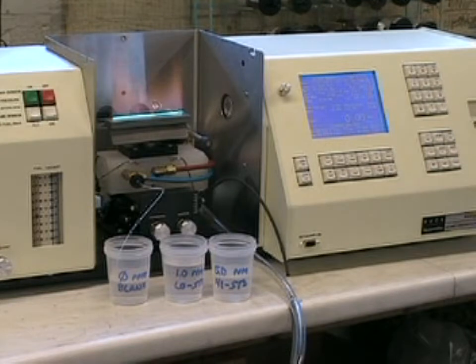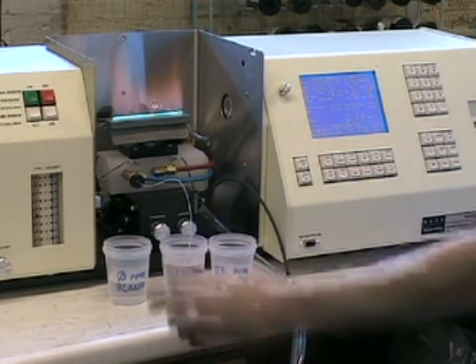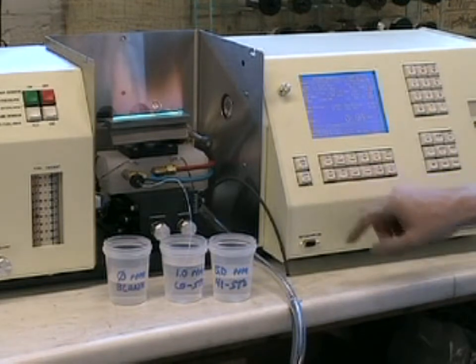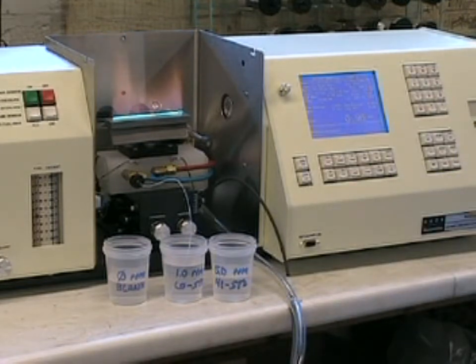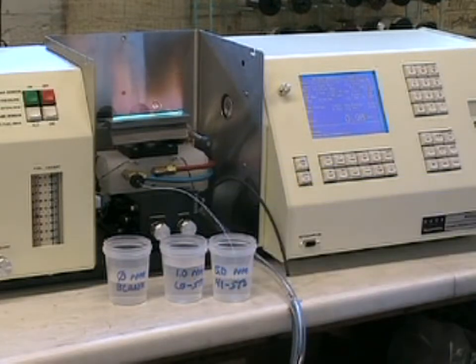Based on a satisfactory calibration, samples can be read by aspirating the sample, waiting a few seconds for the aerosol to equilibrate in the burner head, and then pressing the read key. Depending upon the setup options for the output, the software will automatically calculate statistical values for you, such as average, standard deviation, and relative standard deviation. Please refer to the Buck Scientific 211 manual and mini guide for details of this.